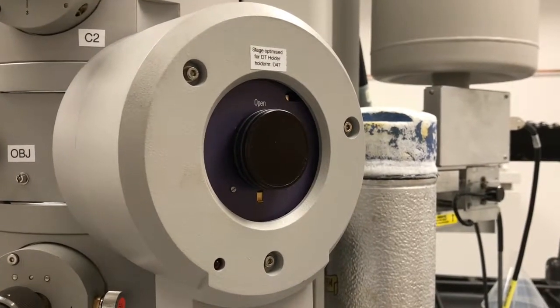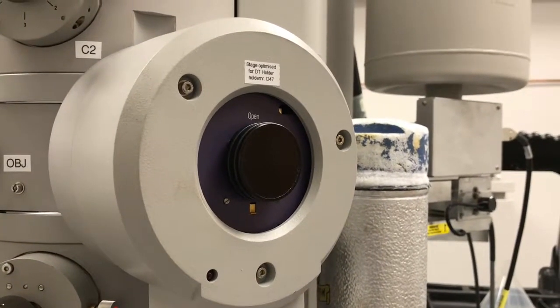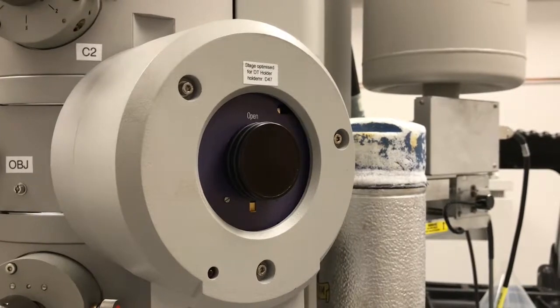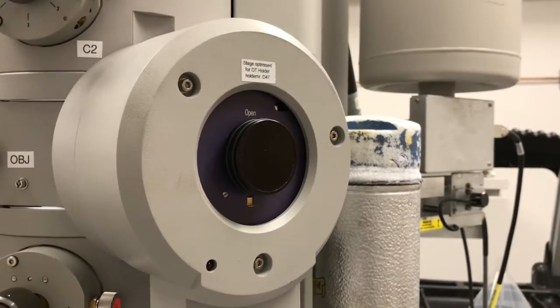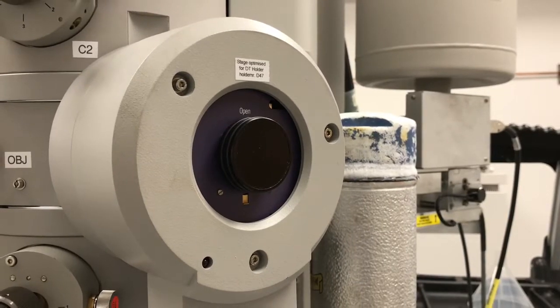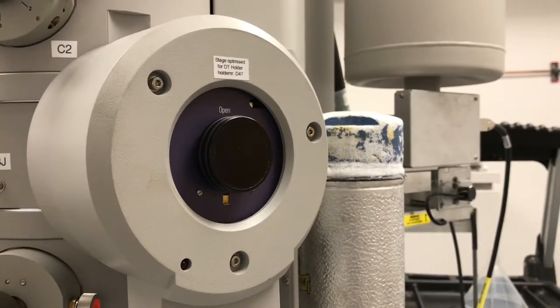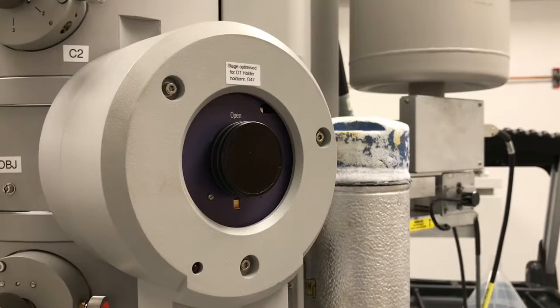I'm filming this demonstration to specifically cover the insertion and extraction of the holder from the TEM column due to a large number of reported incidents of vacuum crashes by users.